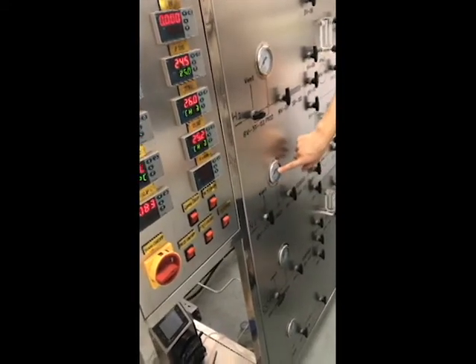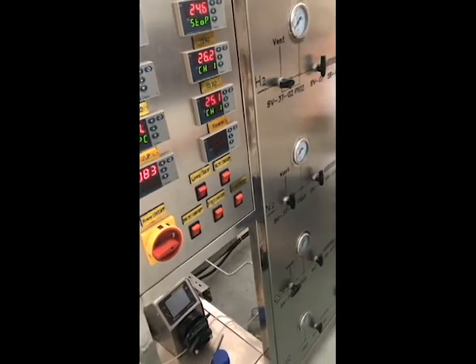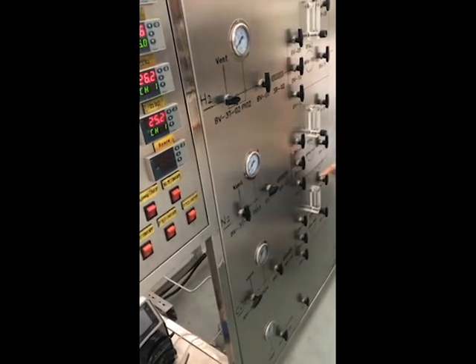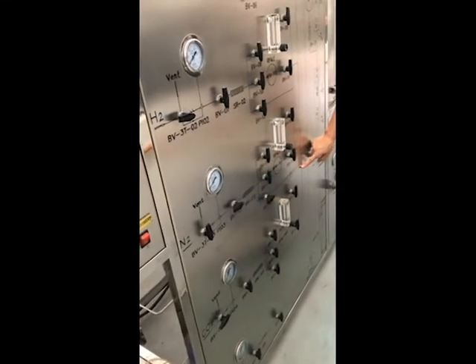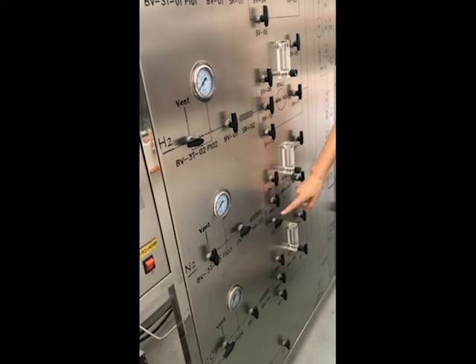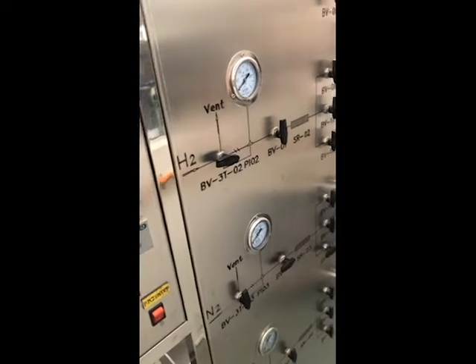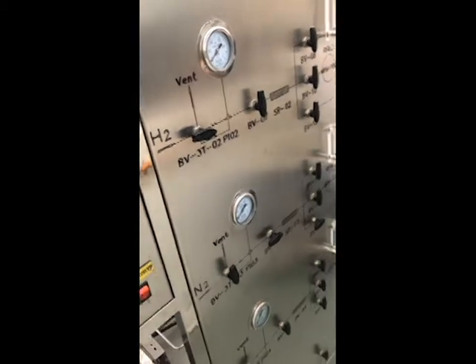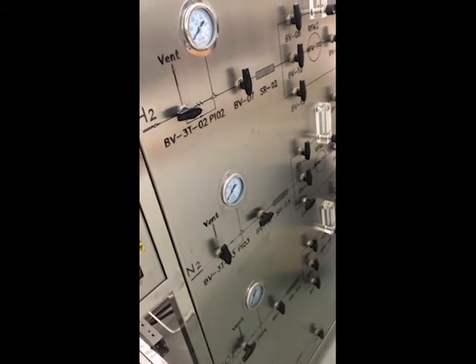Check the pressure meter, the first pressure meter. Make sure the pressure is enough for you to lead to the flow and lead to the reaction. Let it go to the reactor directly from the straight line first. You can see here there are 3 lines. This is to balance the pressure at the beginning, because the reactor has some volume. It needs a little time to fully fill with the gas. So you lead the gas to the system to fully fill with nitrogen first.